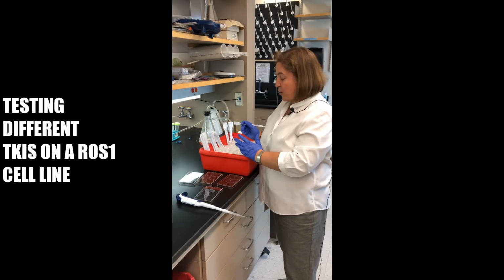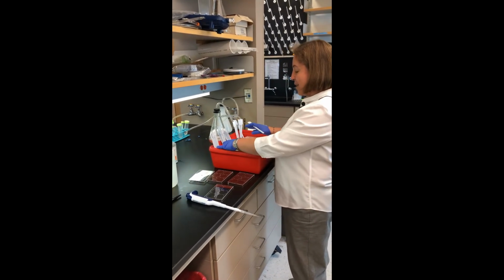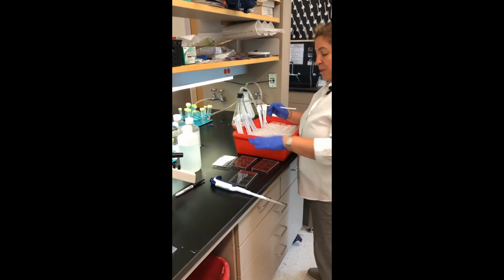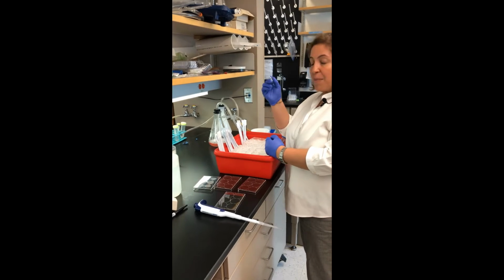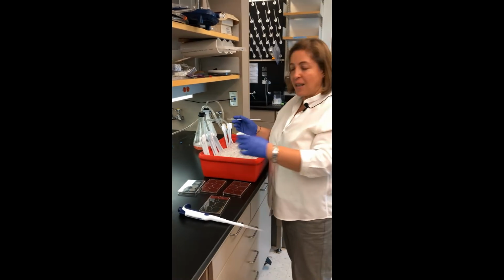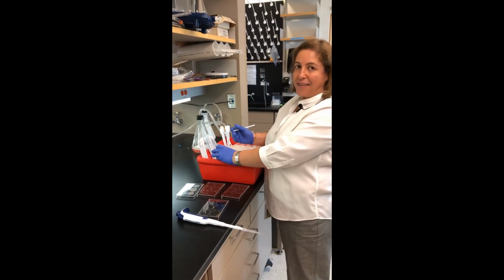So we have the cells in culture, and once we need to do experiments, we transfer them to plates that are defined for the experiment that we need. In this case, I have the same cell line that I put in these wells, and each plate was treated with different concentrations of 4 different TKIs. I go from really high concentration to really low, and then once I treat it, I'm going to extract the proteins of the cells. So I put a solution that will dissolve the cells, and I'll collect that liquid to run and look for signaling proteins to see if the targets are being inhibited by the TKIs.